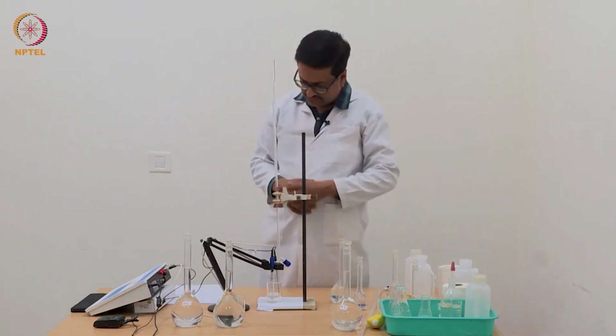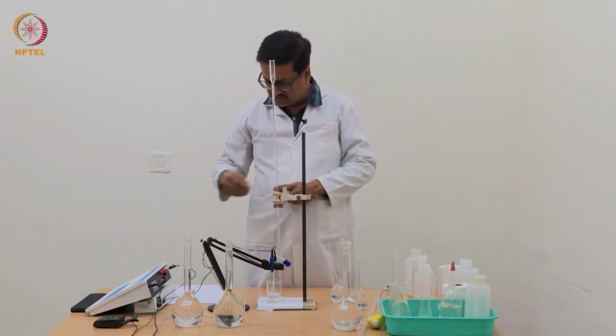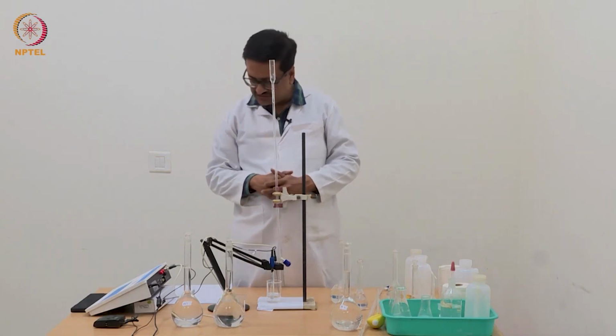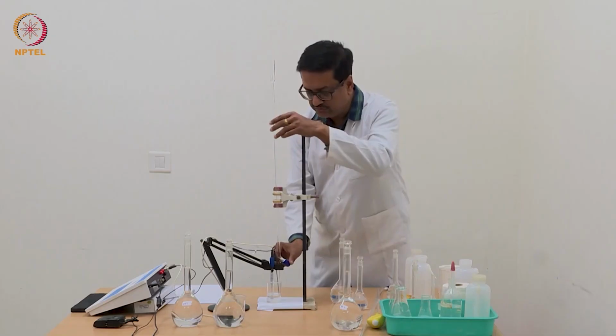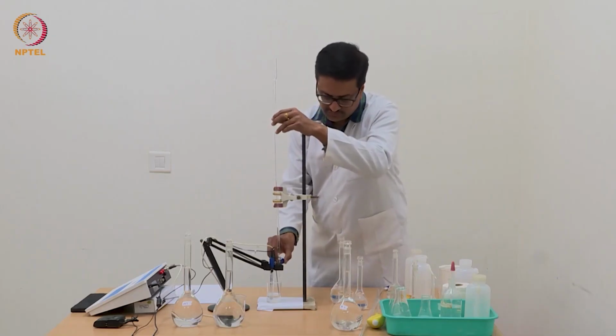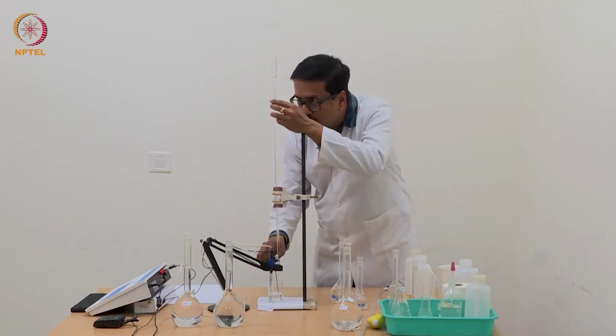So with addition of 0.04 ml of NaOH, now the pH has slightly increased to 2.83. So we will continue to add 0.02 ml further.